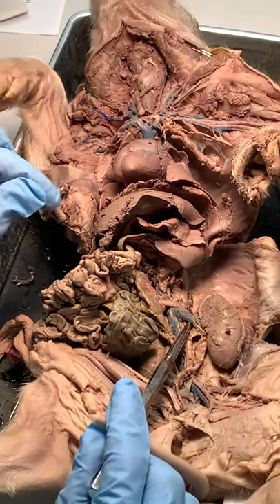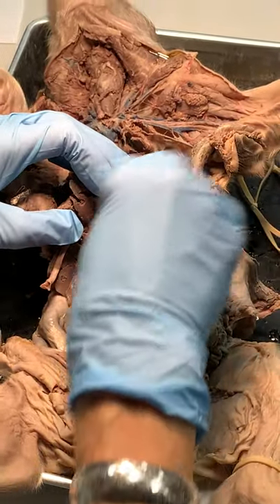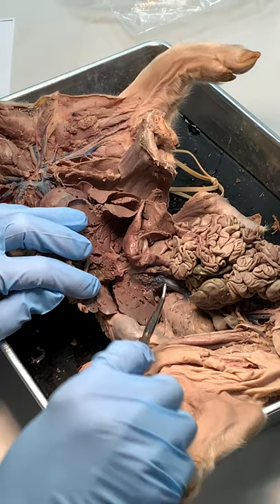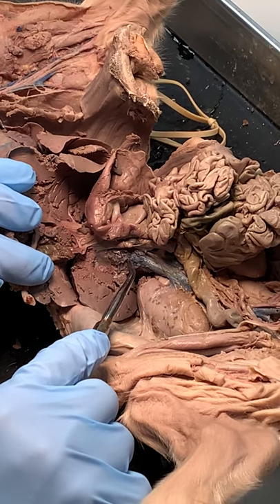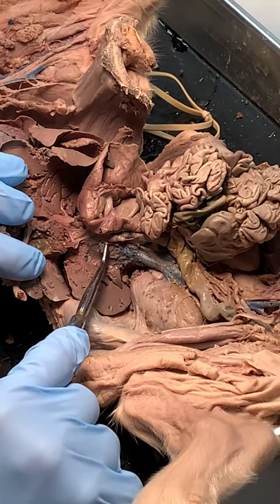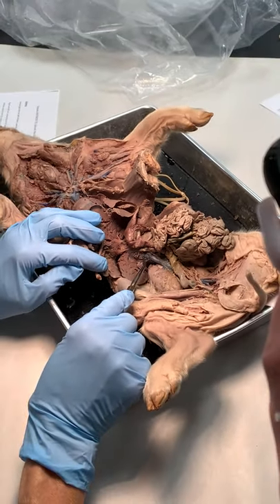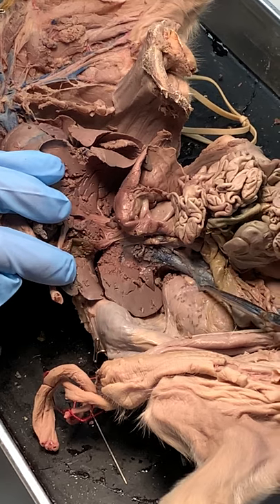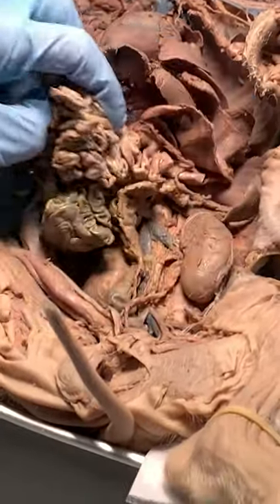The other thing I want to see is the hepatic portal vein. Since the liver's on the right, I've got to go over there — let me move everything off and look under there. There it is — see how big it is? That's the portal vein, the hepatic portal vein going to the liver. There's the little gallbladder hanging out. After it goes through the liver, it goes back to the vena cava. And here's the right renal vein right there — the kidney's still in the fascia, still behind the wall.